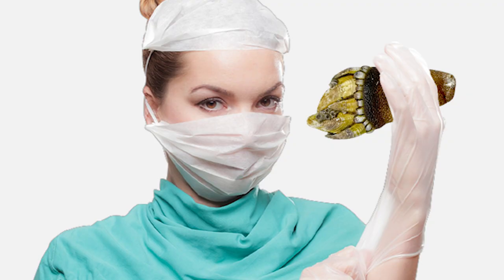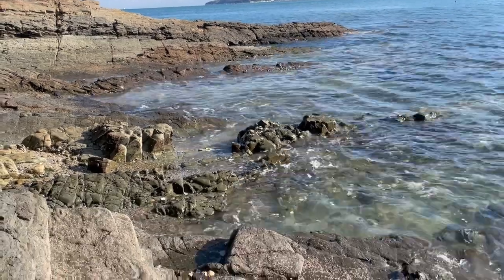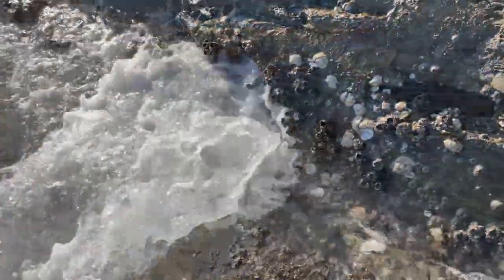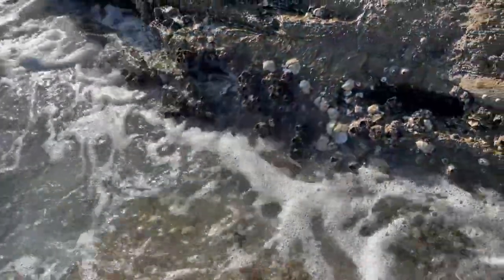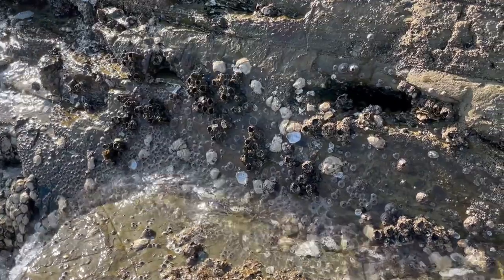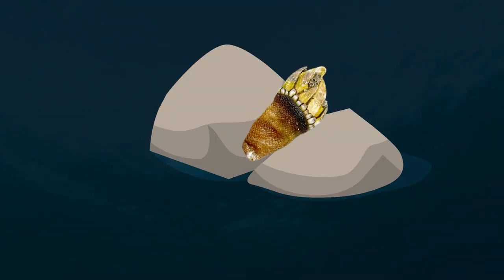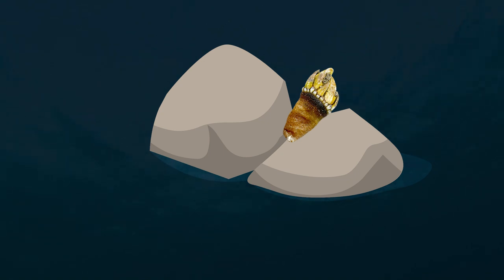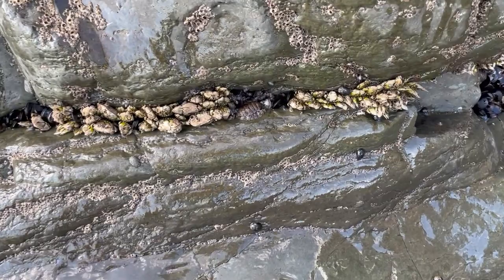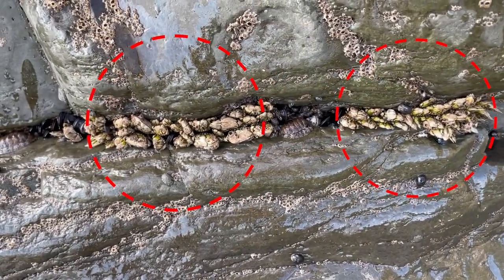Let's do the gooseneck barnacle anatomy. The gooseneck barnacle usually lives on rocks in the intertidal zone. In this area, many creatures live attached to rocks to prevent them from being swept away by waves. Gooseneck barnacles also live by sticking firmly to the rocks. If you look closely at the cracks in the rocks, the pointy thing over here is the gooseneck barnacle.